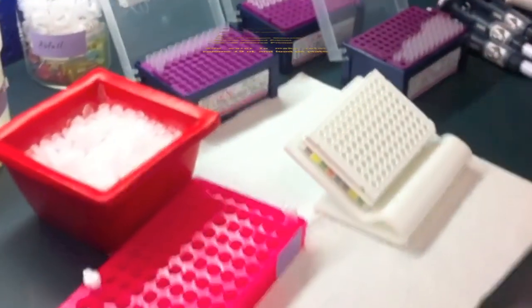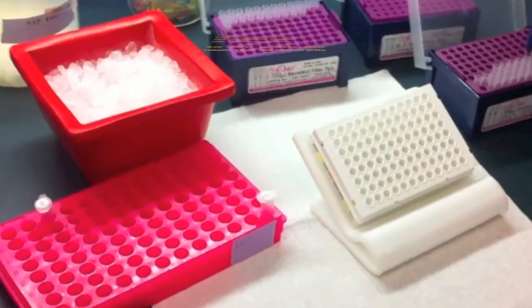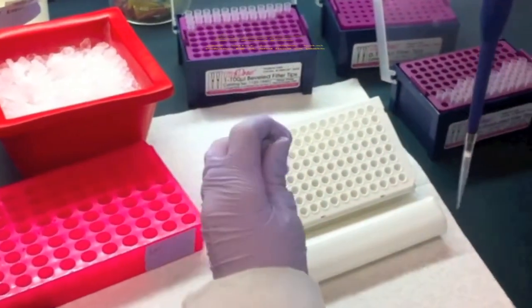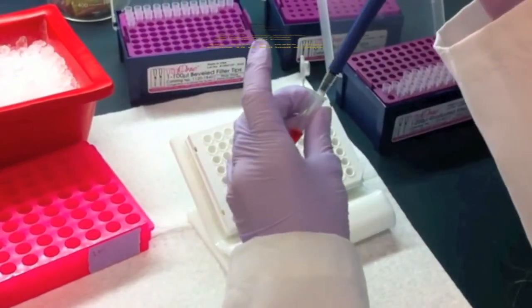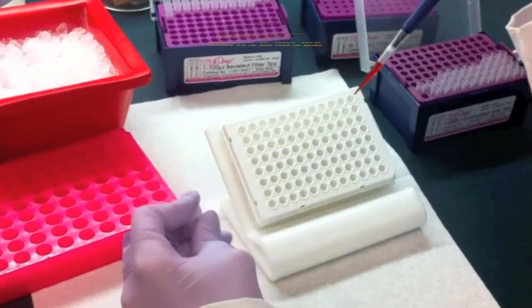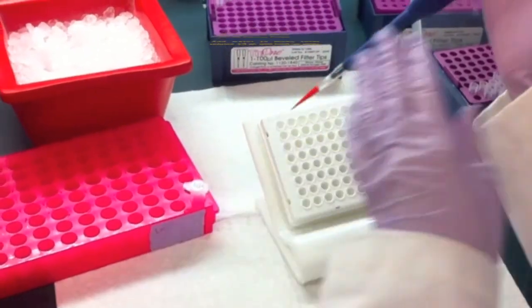Next, plate the MasterMix into the 96-well plate. 3 wells per sample for triplicates.